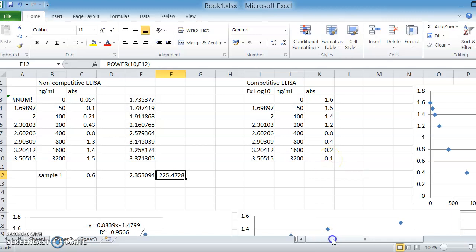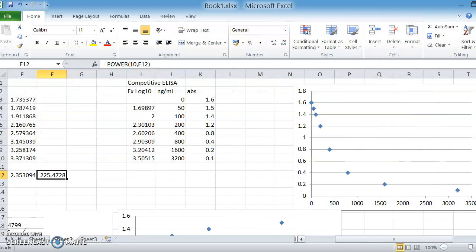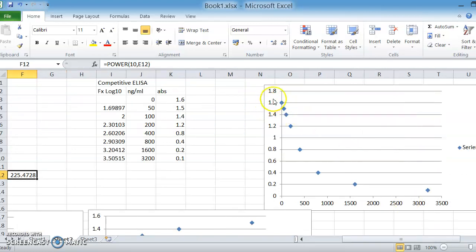And this is why in some ELISAs, and I don't know which way around they are, but one of the ELISAs that the group studied, if you plot the data linearly, you'll get a graph that looks something like this. And the first thing students say is, that's back to front. Well, it isn't. That's the way a competitive ELISA works. All we have to do now is do exactly the same principles. We need to plot the log of the standard against the absorbance.